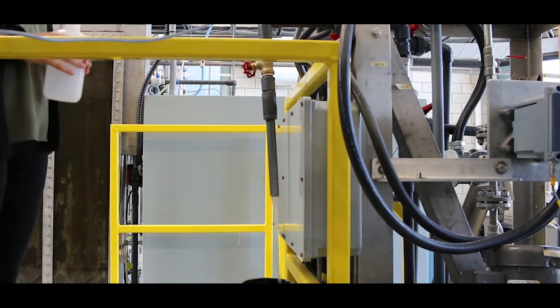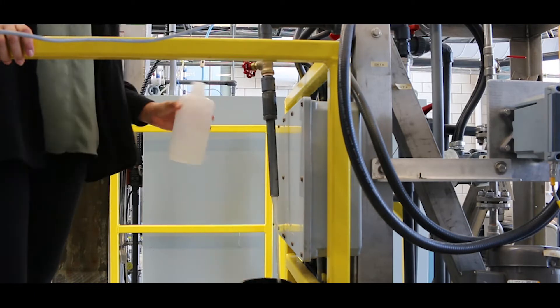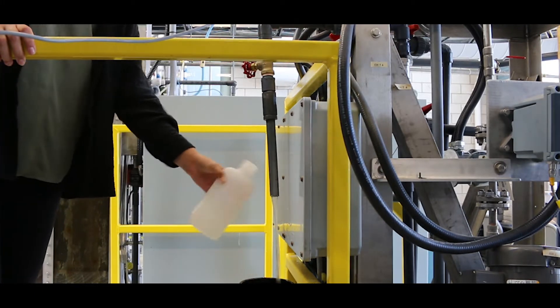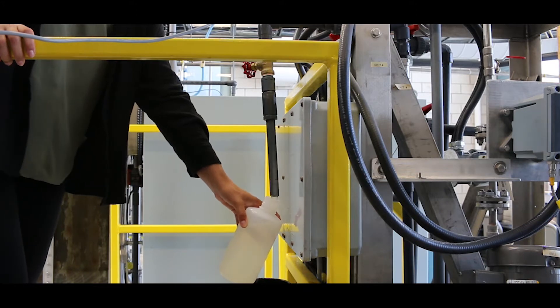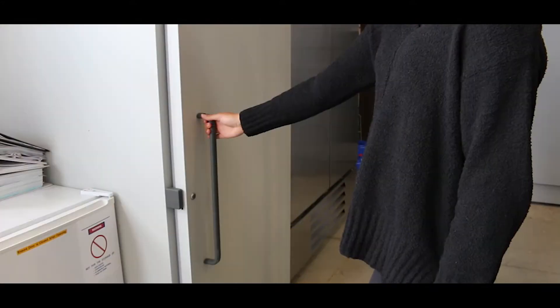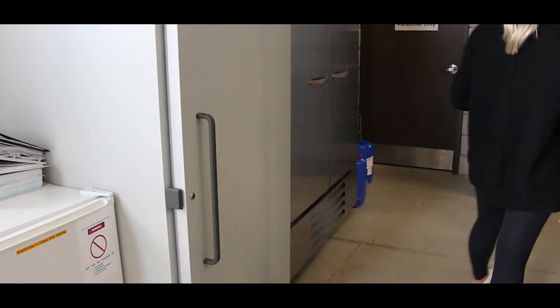Collect your sample in clean glass or plastic bottles and analyze as soon as possible for best results. To preserve samples for later analysis, fill the bottle completely, tighten the cap and refrigerate it for up to 48 hours. Let the sample warm up to room temperature before analysis.